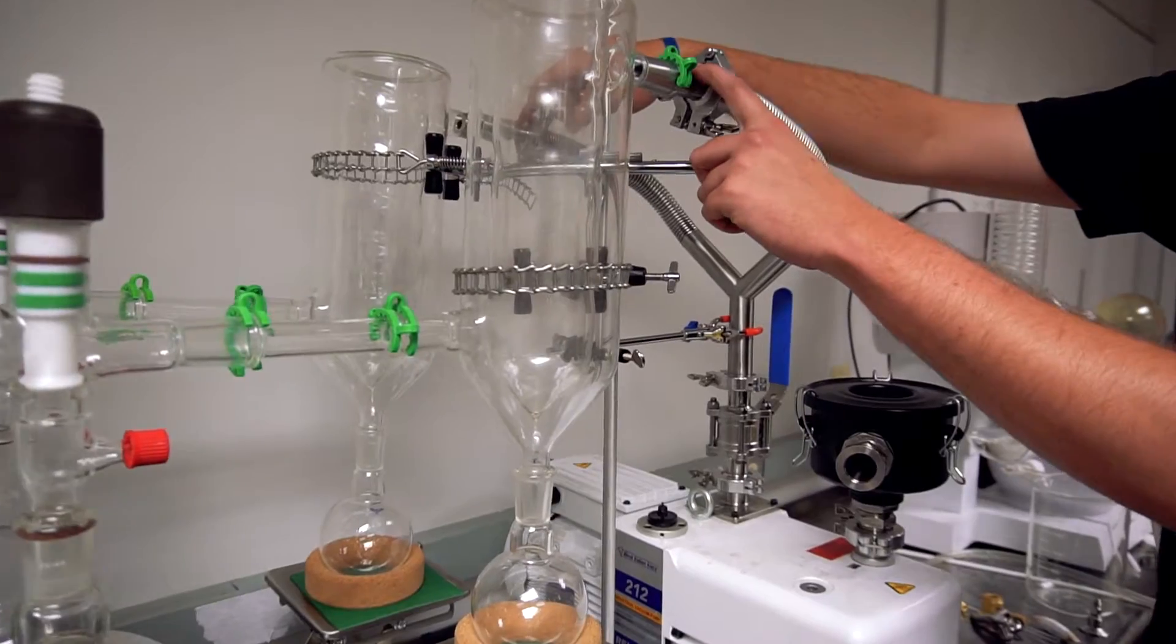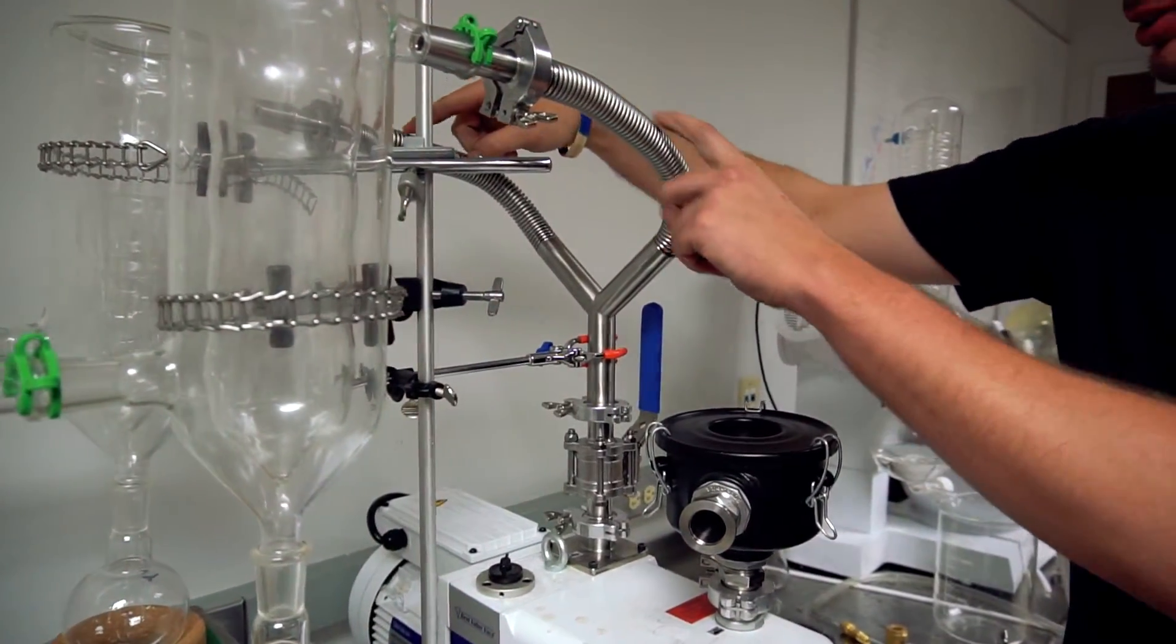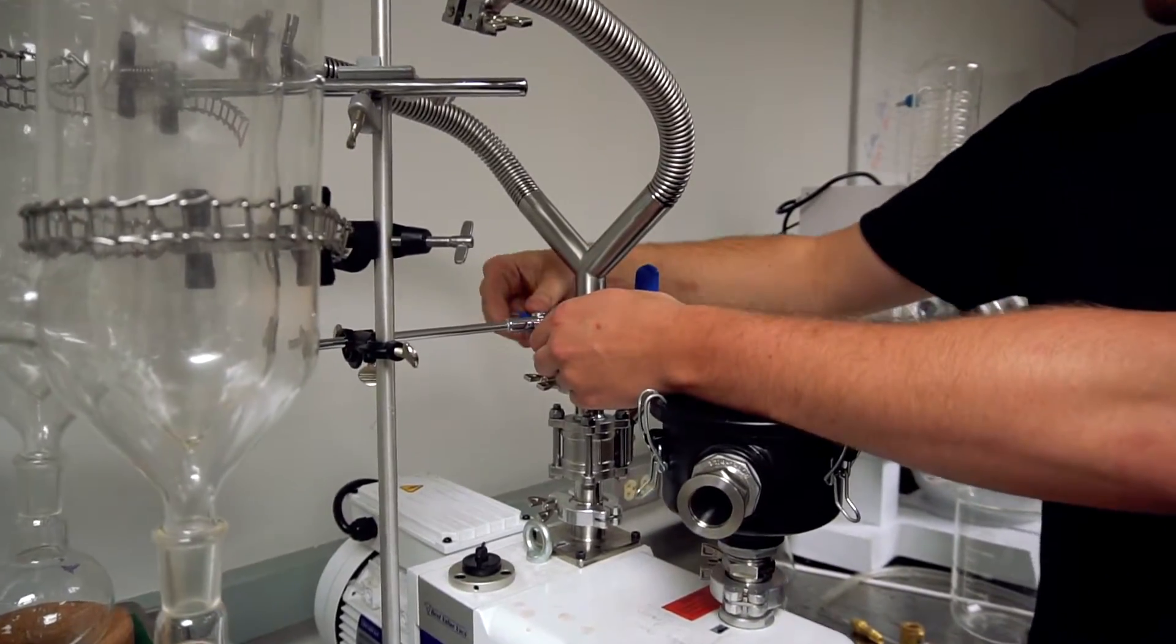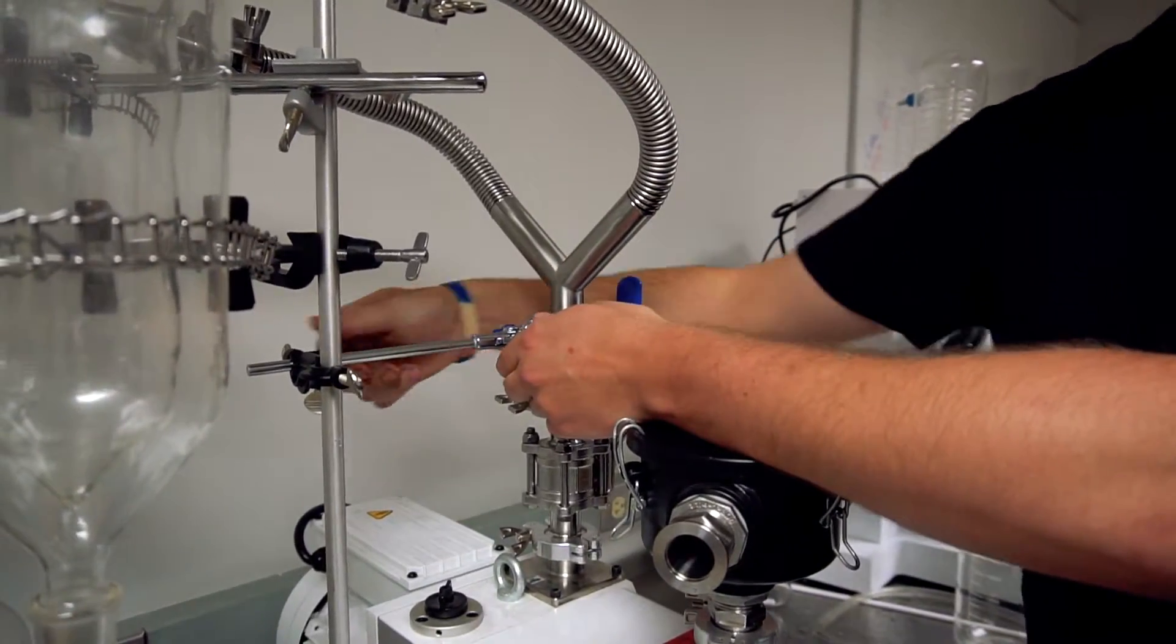We have two adapters right here which goes to this Y bellows. So this bellows is fairly important. It allows you to have equal lengths of hose to both sides of the system.